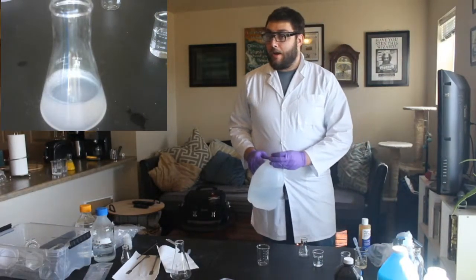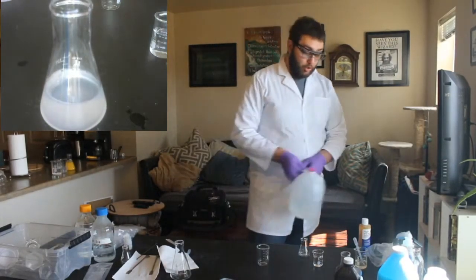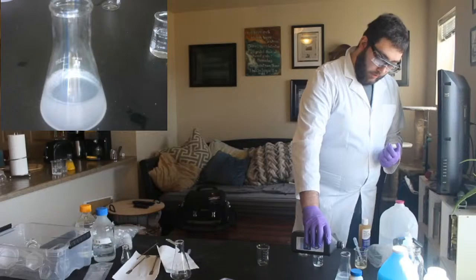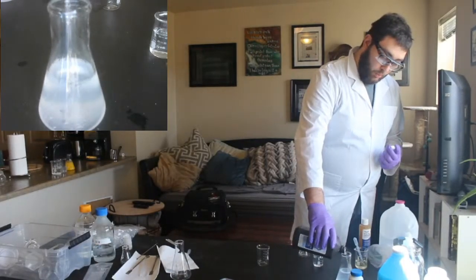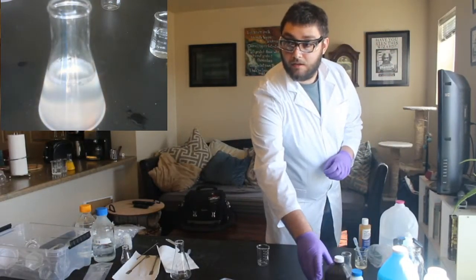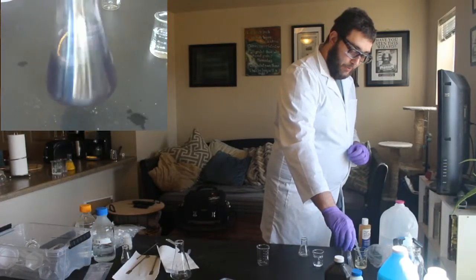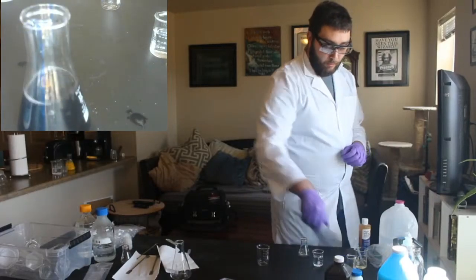Can you add more hydrogen to make it faster? Yes, that is a great call, and we definitely could. In fact, let's test that, right? We don't know how long this is going to take, but you're right, adding hydrogen peroxide will speed up this process. And you know what another factor of this is? Yeah, or add less vitamin C, exactly. Oh, there it goes. So you can see we added more hydrogen peroxide, and bam, it went.